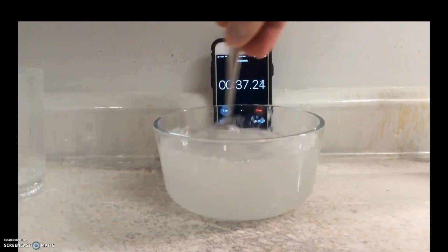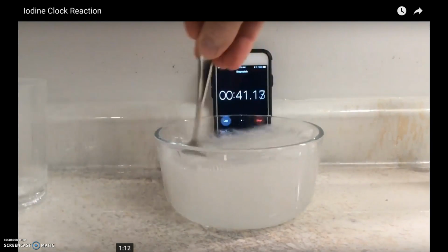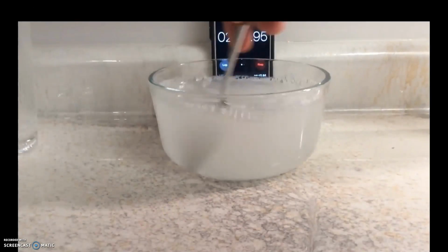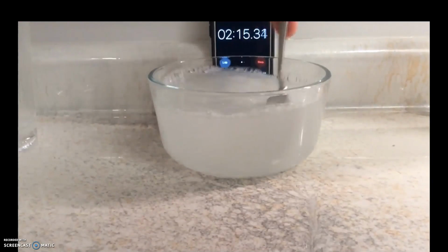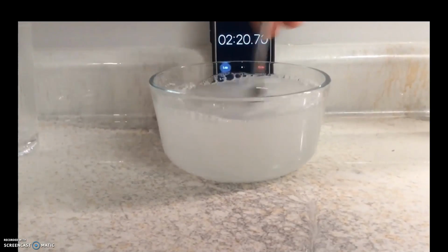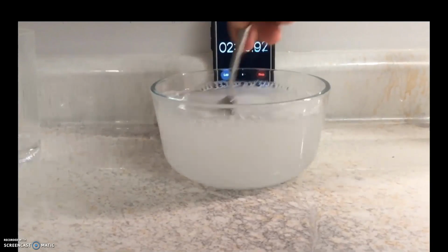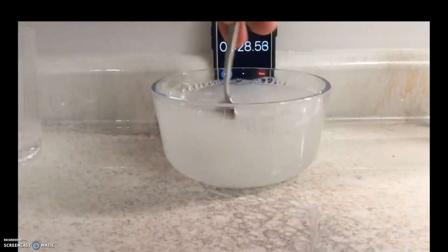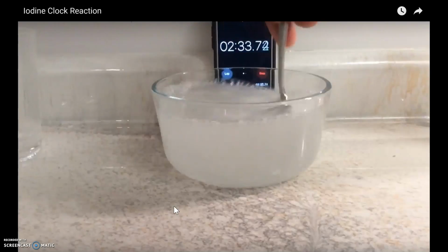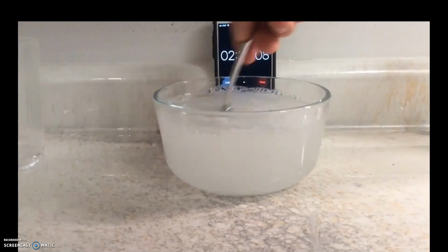But here you see me mixing. As I fast forward a little bit, I'll pour in a little more hydrogen peroxide. I thought maybe I did not have enough, so that there was an excess to create those I2 molecules, which is where we would see the color change. So I added some more hydrogen peroxide and kept mixing. Another thing, which I'll follow up on the next slide, is that I did not heat up any of my solutions. They did in the video to speed up those reactions.